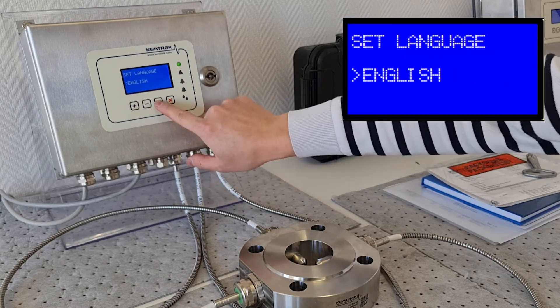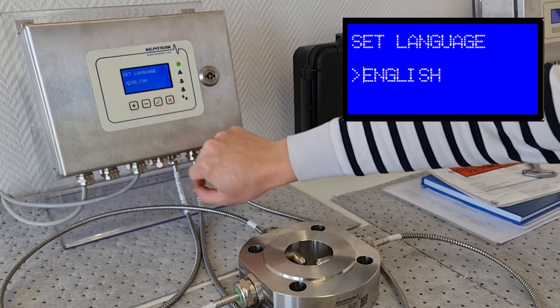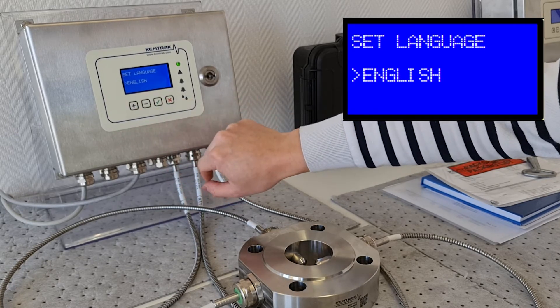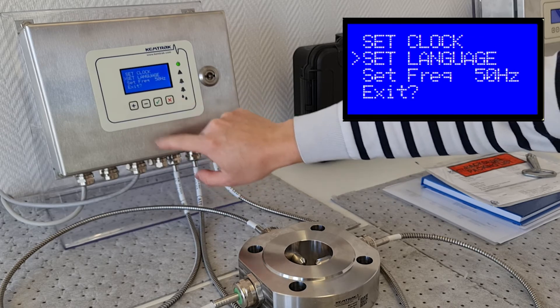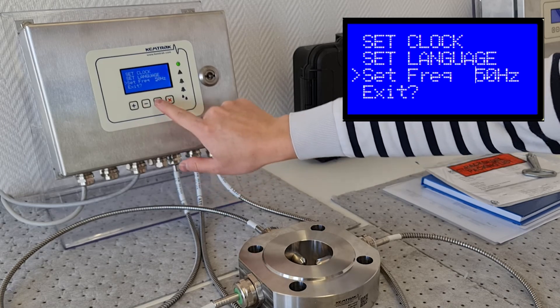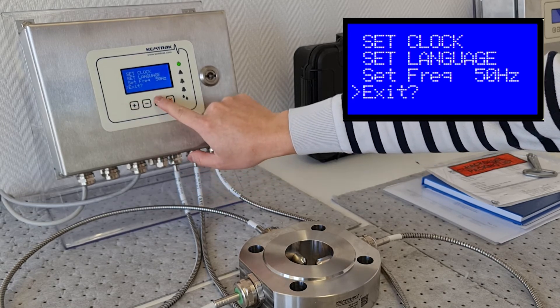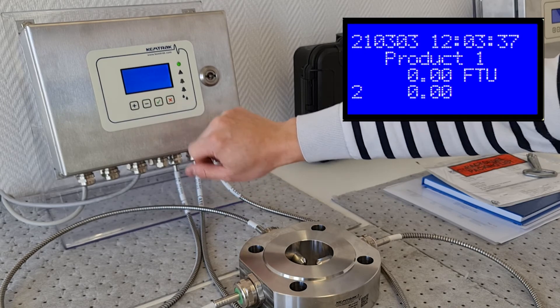Next select the required display language, then the mains frequency. And finally, select exit and confirm to start using the analyzer.